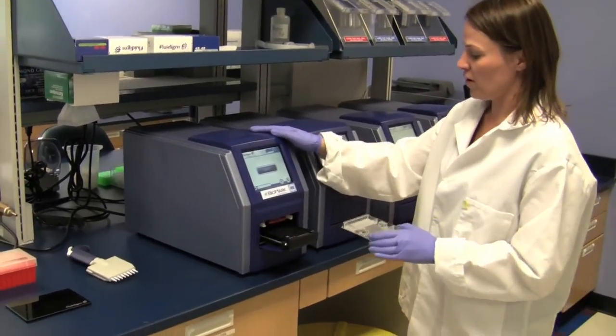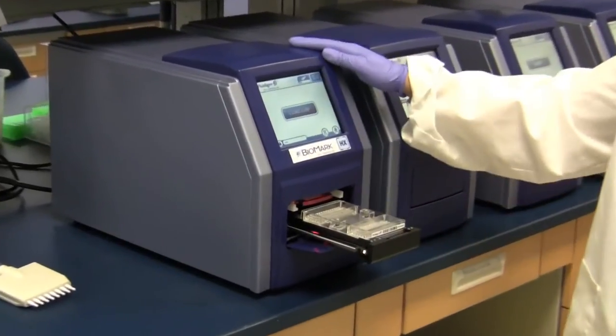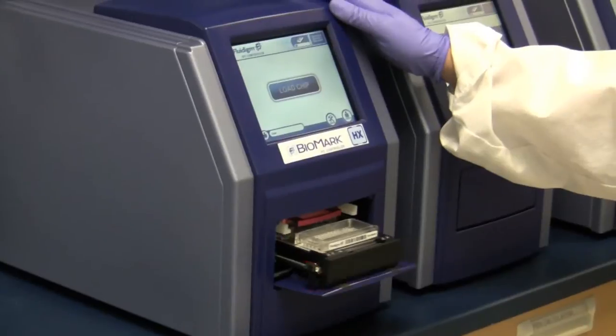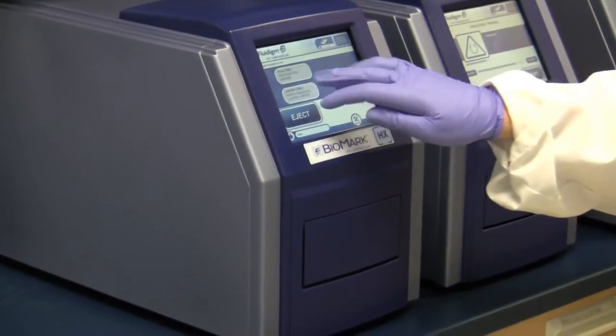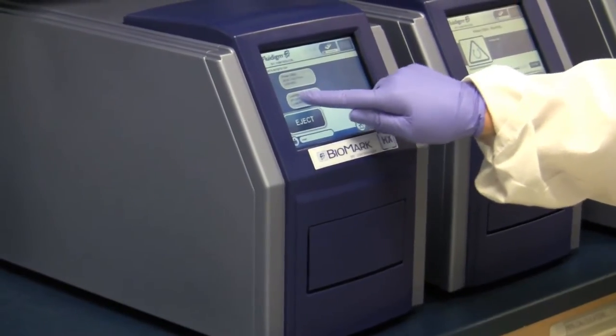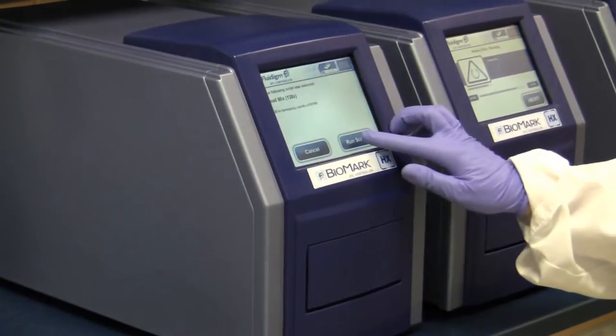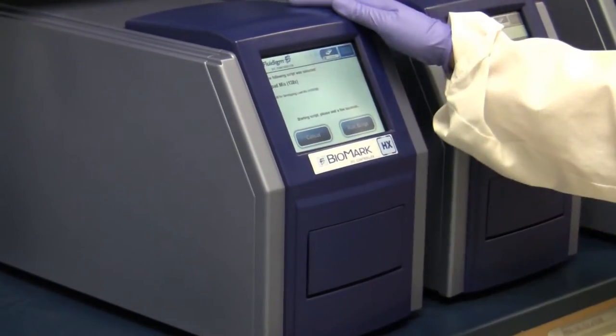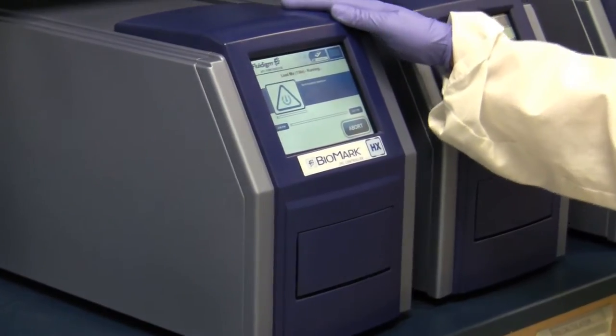I'm going to place the chip on the tray. I'm going to load the chip. I'm going to choose the load mix script. And then I'm going to press run script. And that's all you need to do. Everything else is automated.